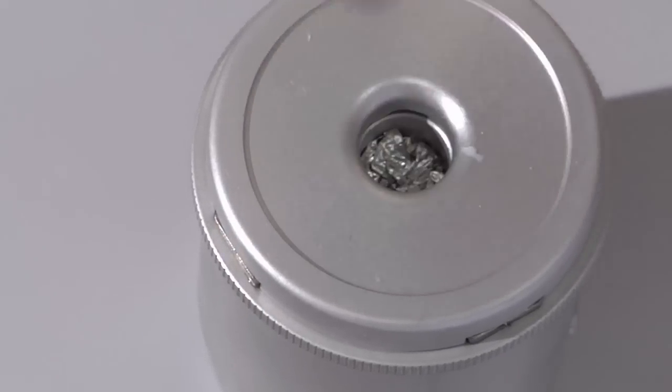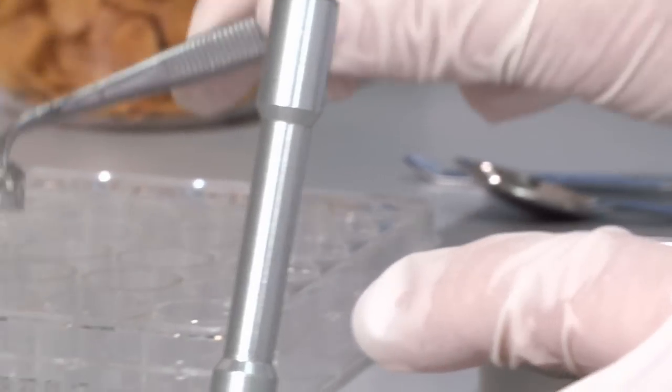After closing the tin foil capsule, it is directly loaded into the auto-sampler.